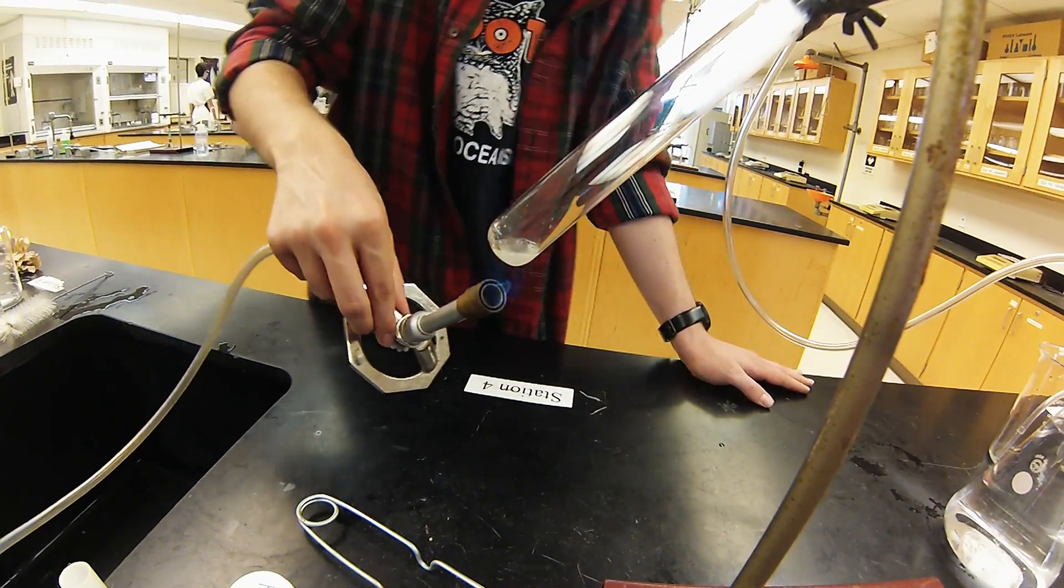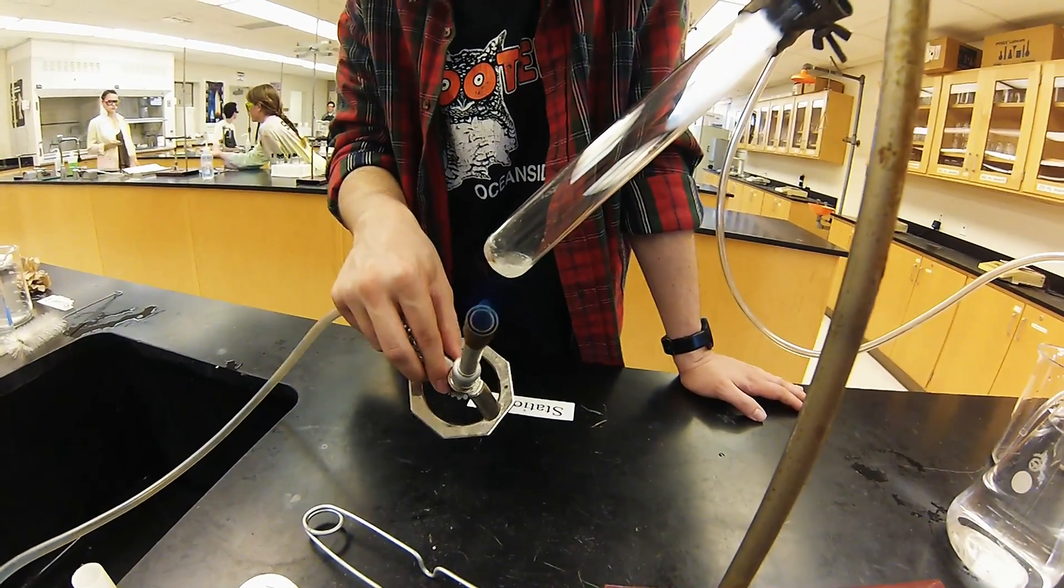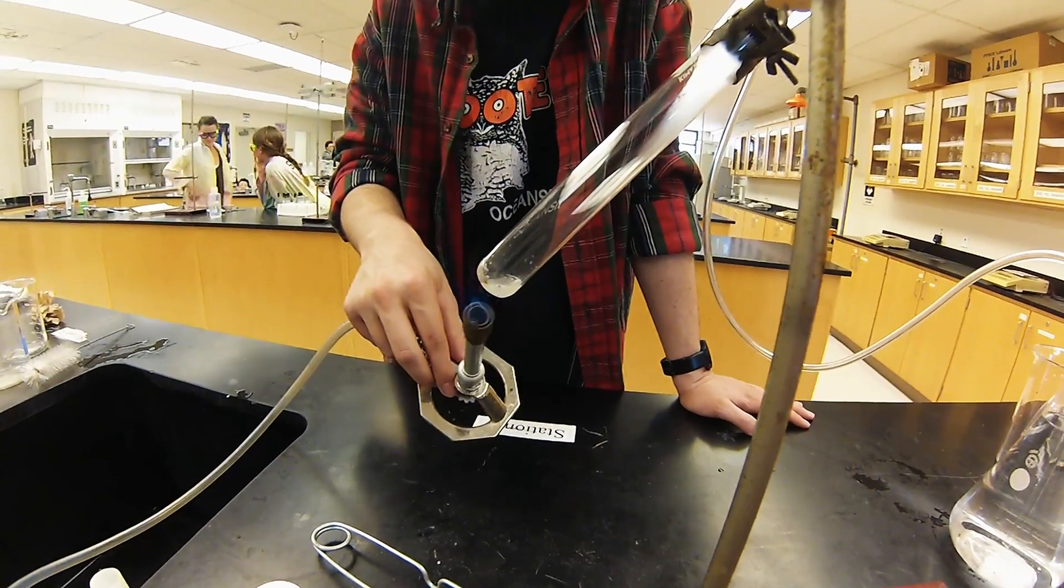It's very important to keep clear of the flame when you're picking up the Bunsen burner like this. You don't want to burn your eyebrows.